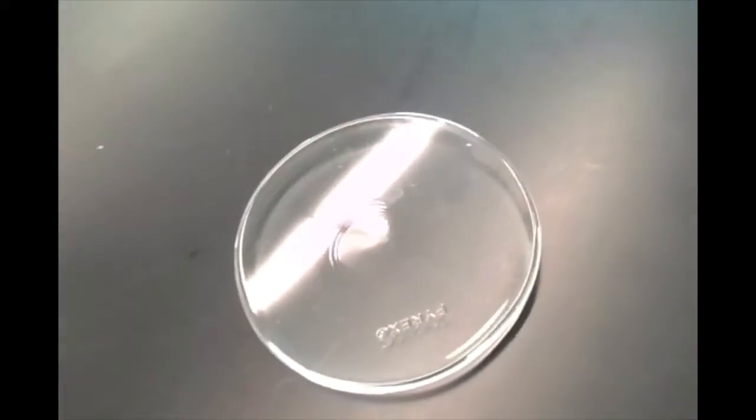You can't destroy matter, it's just that all of the ethanol has been changed. Let's see if I can get a good, there we go. All of the ethanol, oh yeah, it's cool enough to touch now. But you can see that there's no more liquid left on here. All of the ethanol has been changed into gaseous products. So there's no residue, nothing left behind. It burns very, very cleanly, as you can see.